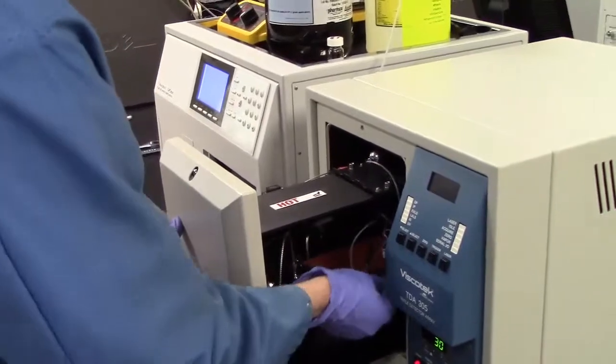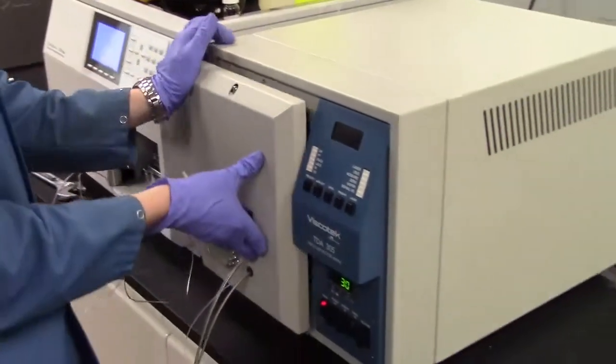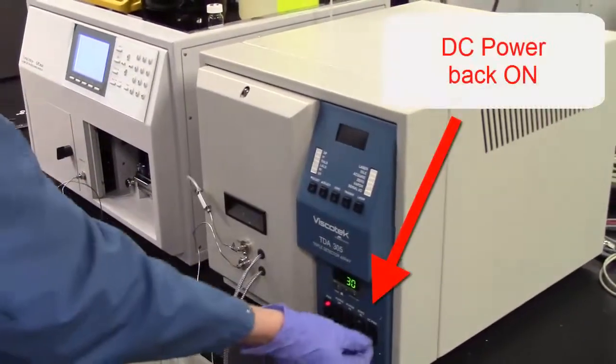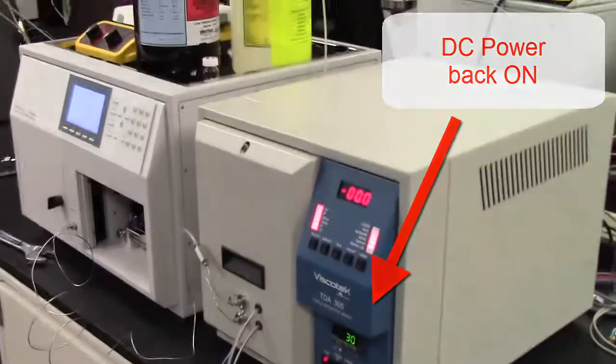Once you have replaced the module back in the chassis and made sure it fits securely, then turn the power back on and you're ready to go.